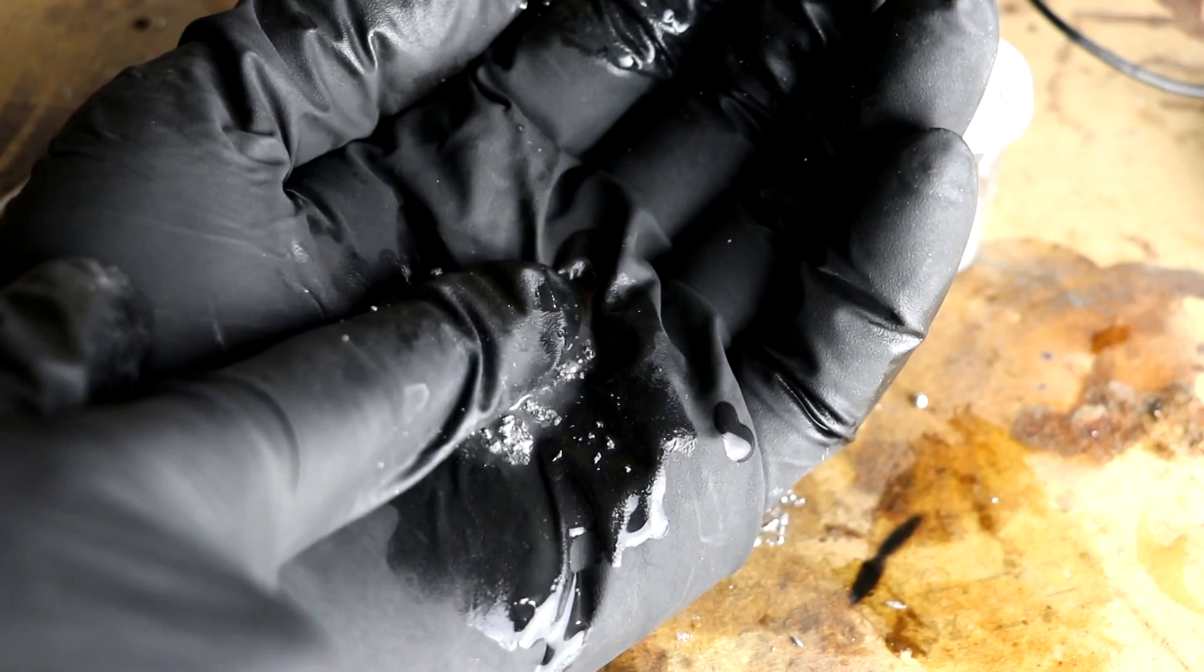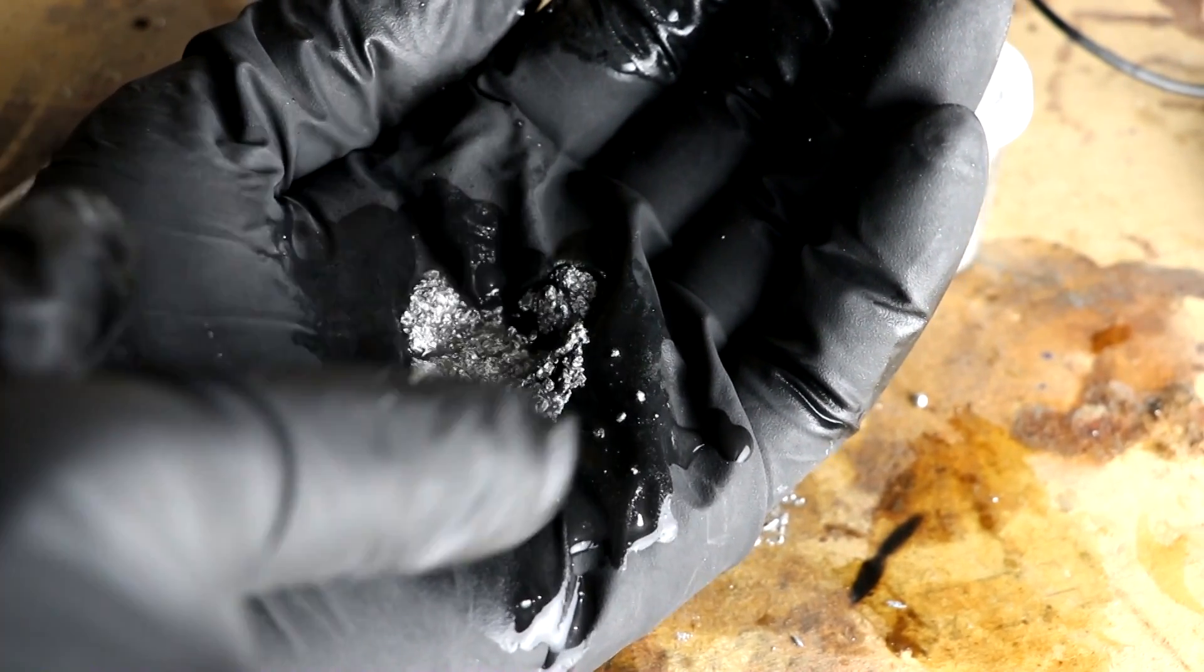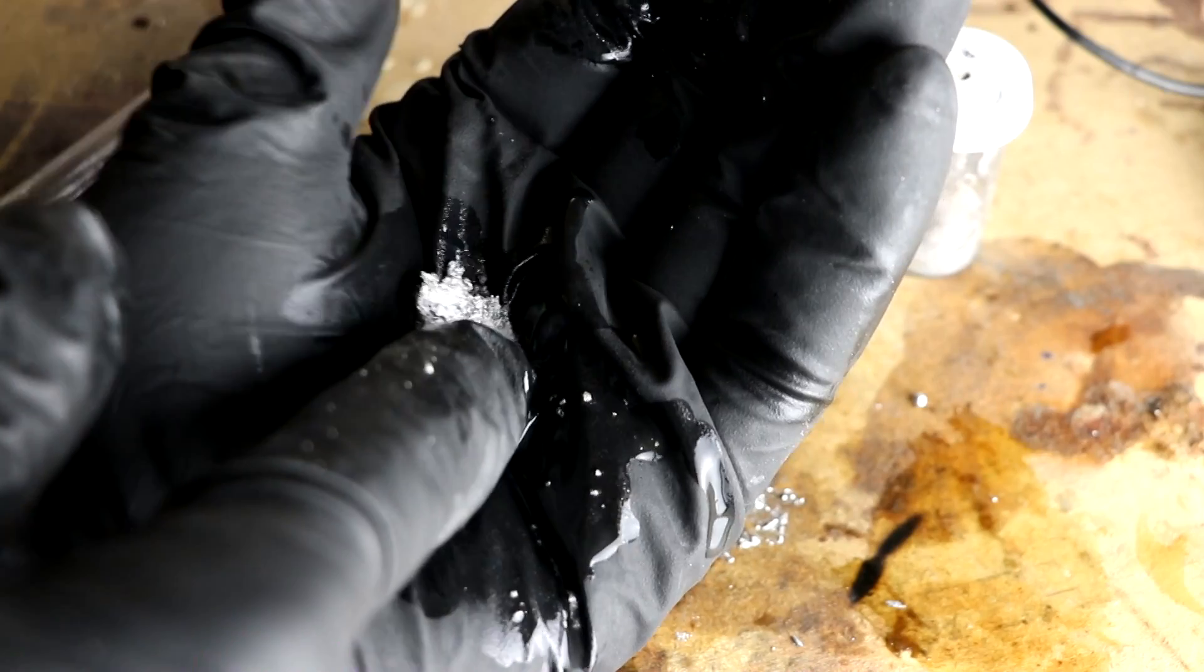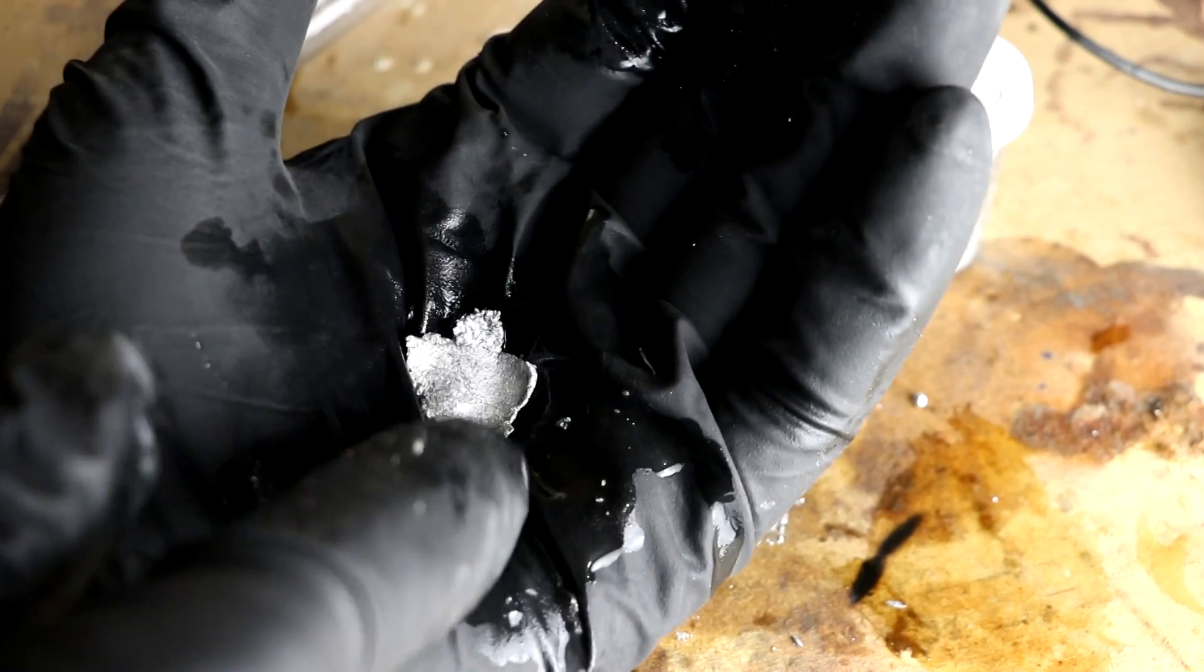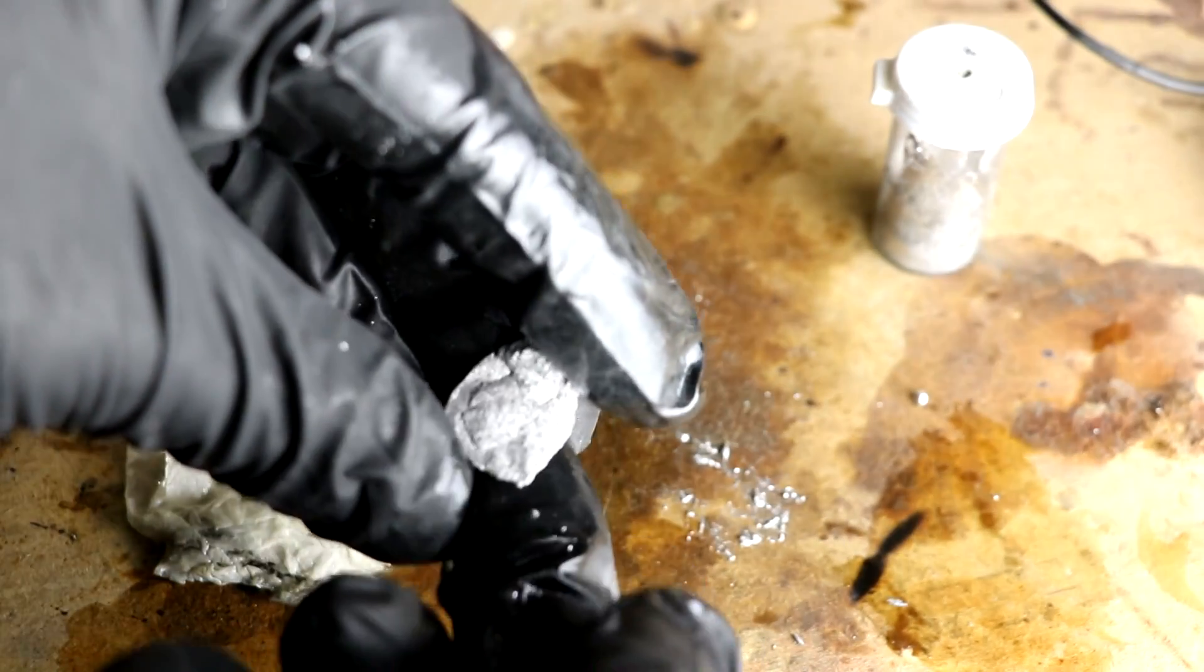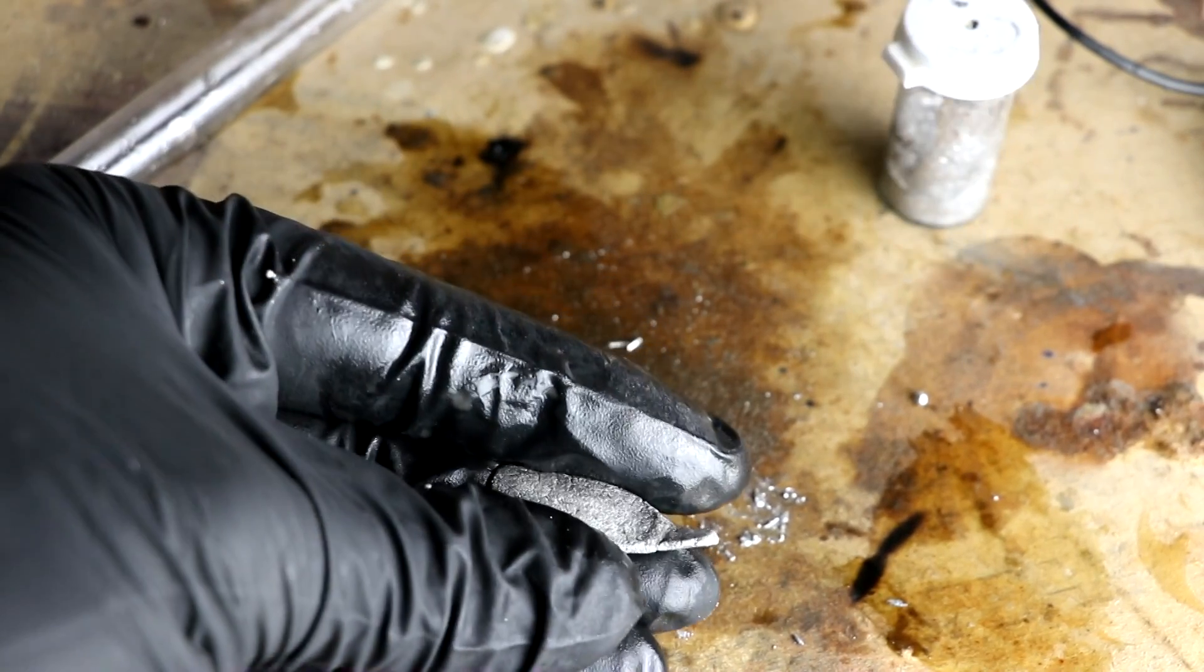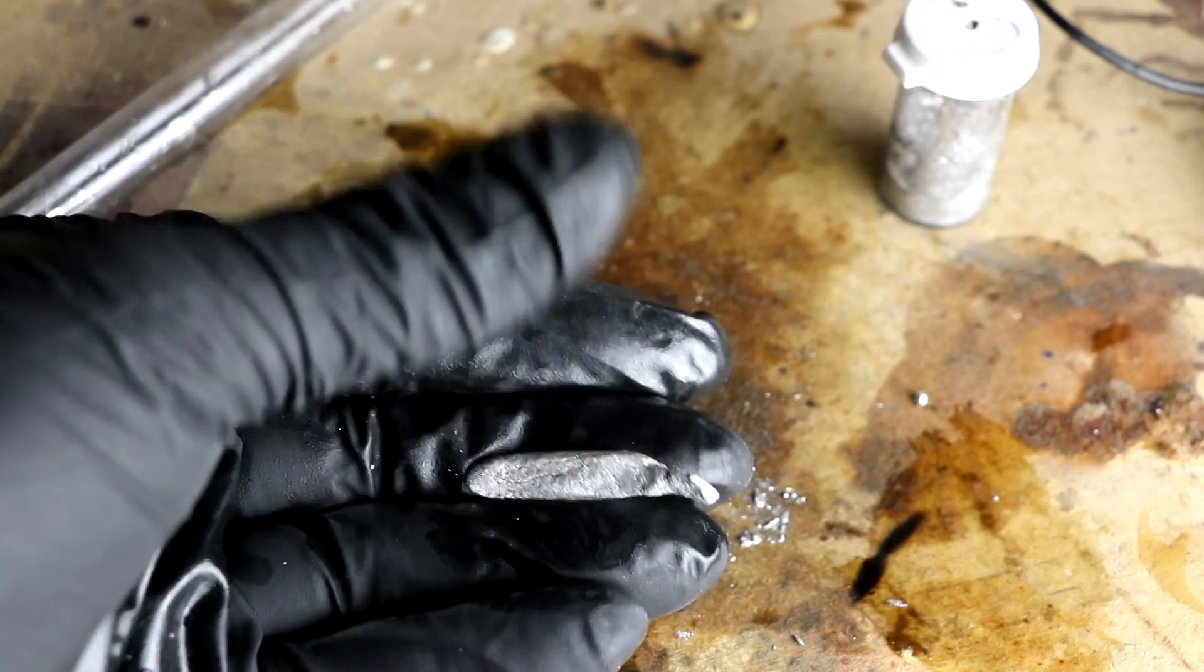So here's the metal after the sodium has been burned out by the water. At least most of it has been. If I push it back together, looks like it will liquefy again if it's not too badly oxidized. Yeah. Actually, you know what? This is not liquefying. I bet what happened is the gallium basically has been extracted. Yeah, I think this is probably more pure gallium. It doesn't have as much of the indium and tin in it anymore. Either that or there's more indium. I'm not entirely sure what this composition is left over here, but it is definitely different.